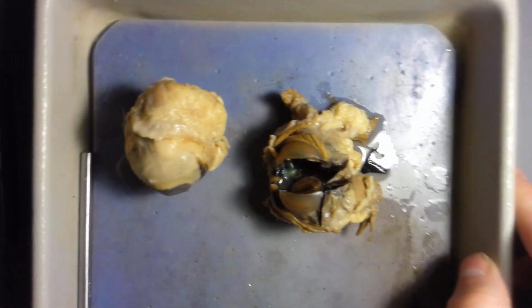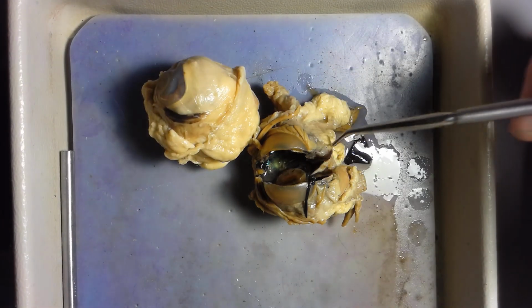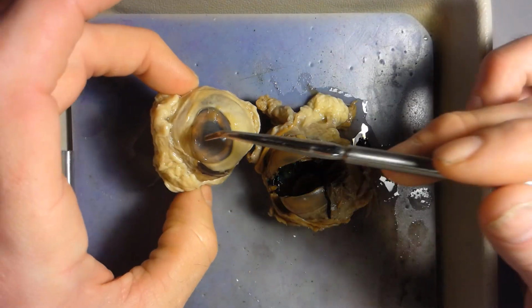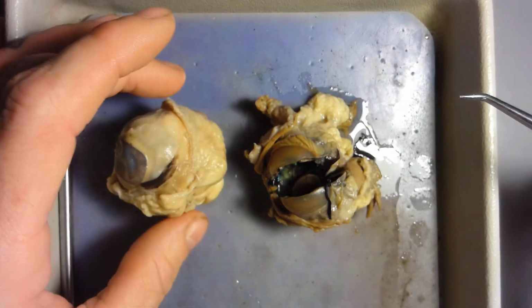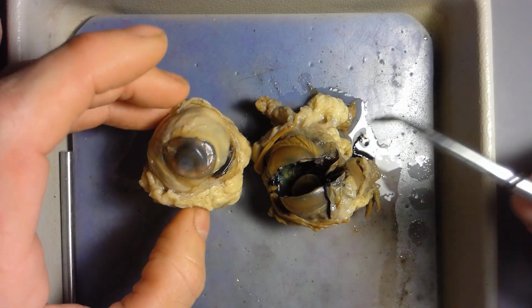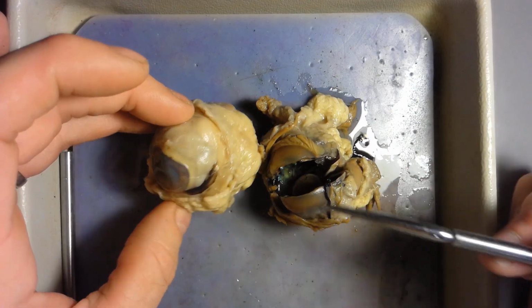Alright. Next, I'm going to show you the actual eye. Now, these are the sheep eyes right here. One I have cut open here, and I will show you some parts in that. And then here's one that is not open yet. Okay, so looking at the same structures that we talked about on the eyeball, I'm going to start off on the top here and point out some things that you can see easily with this eye.